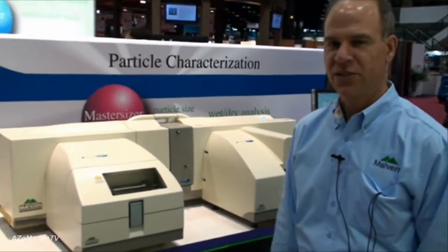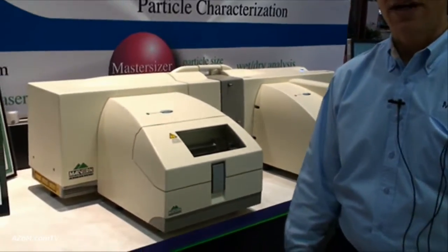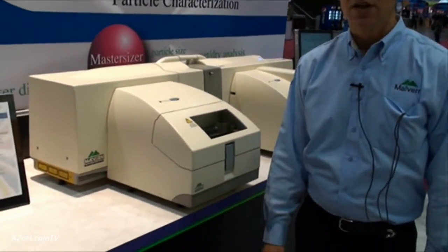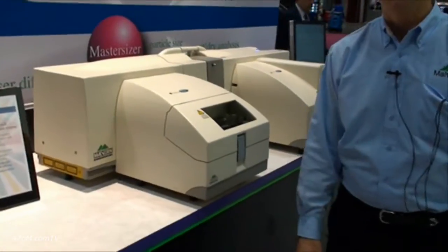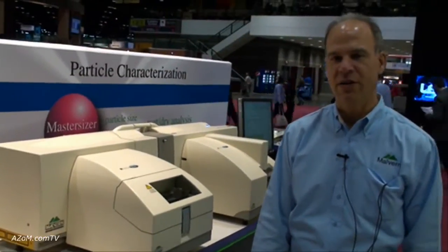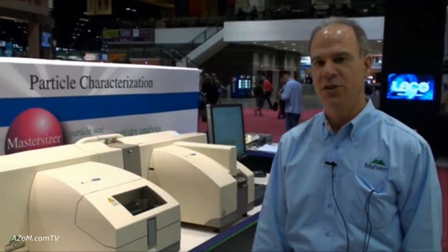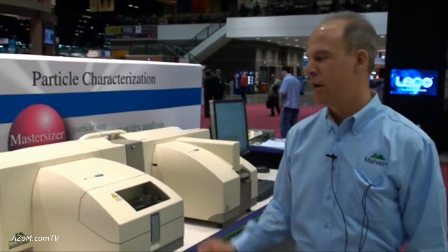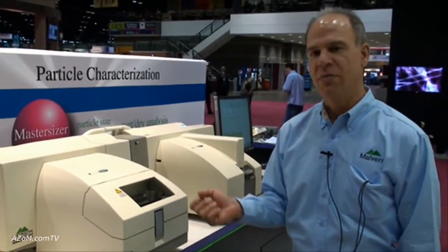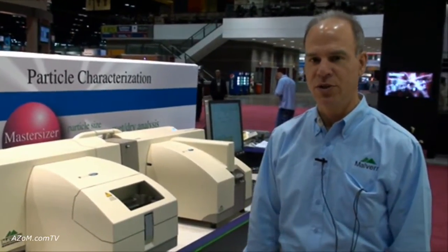This is the Malvern Mastersizer 2000, our famous laser diffraction particle size analyzer. This instrument uses what's known as laser diffraction, or low angle light scattering, to measure particle size distributions. The Mastersizer 2000 can measure from 20 nanometers or 0.02 microns up to 2,000 microns or 2 millimeters.